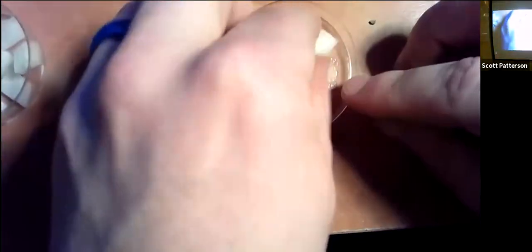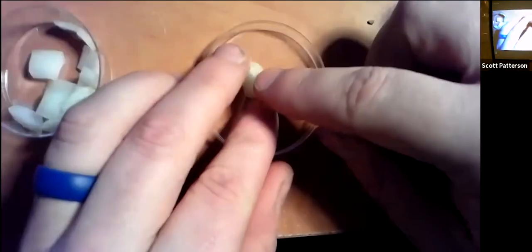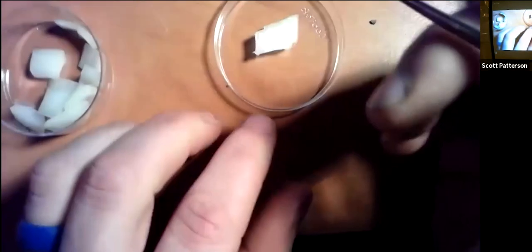Seeable. So we got a little piece of onion, and you'll notice that this little piece of onion we could probably even break into a couple pieces. Like we got a big honker, look at this thing. See how it's really two pieces? And you'll use the forceps, which are like big tweezers. See, now it's two pieces.